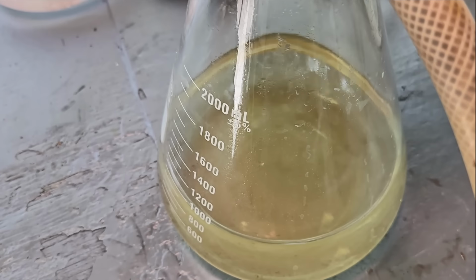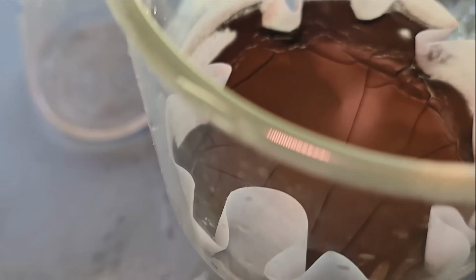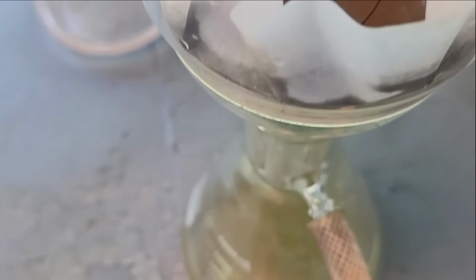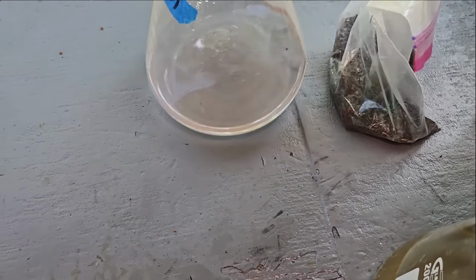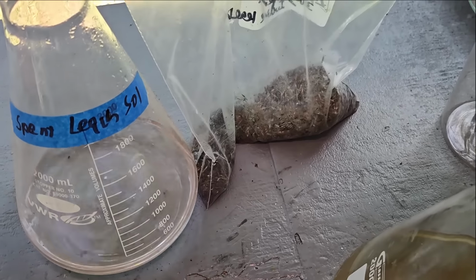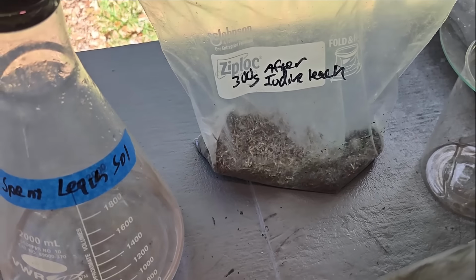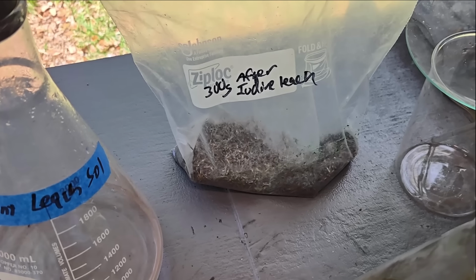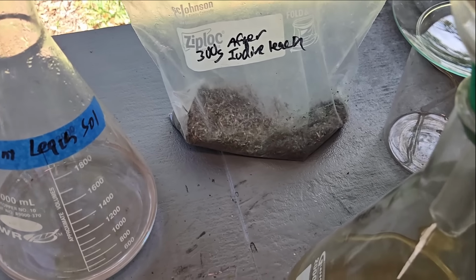Every once in a while a drip still comes through. I'm going to let the pump run a little while longer and get this stuff as dry as I can. Then I'm going to transfer this liquid back into my spent leach storage bottle. I've put the pins into this bag after iodine leach. So there's a lot more than 300 grams of pins in there now because I've done this a few times, but any gold left on those we'll get somehow in the future.